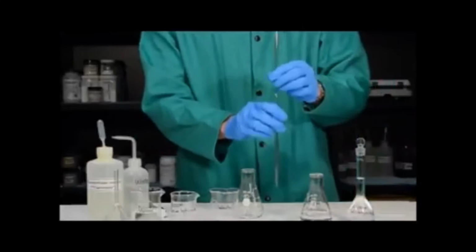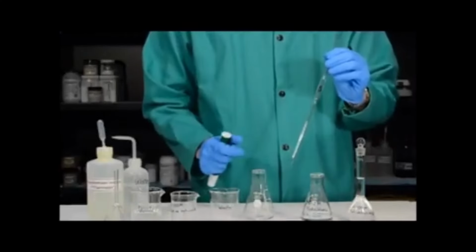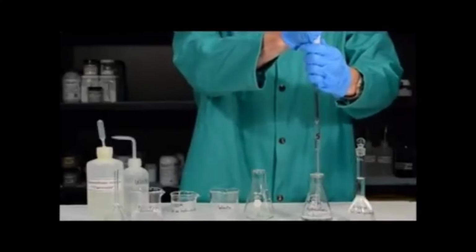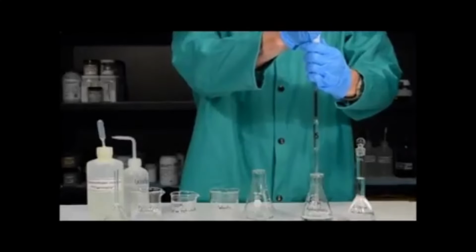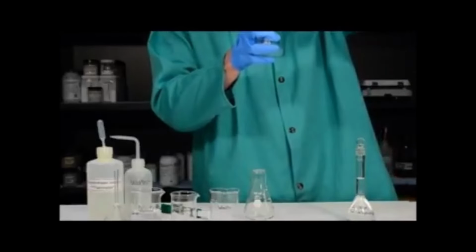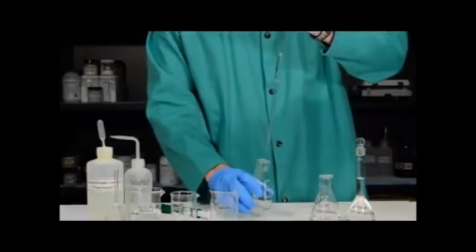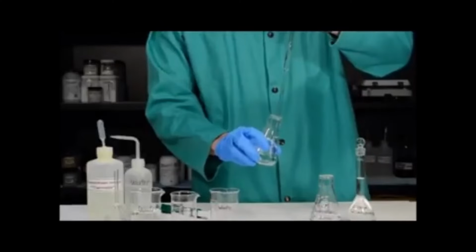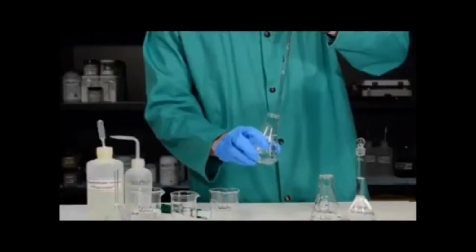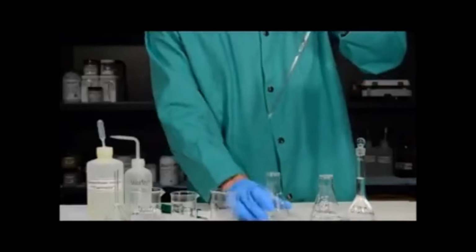We want to use a 5 milliliter volumetric pipette to transfer 5 milliliters of the hydrochloric acid solution into the Erlenmeyer flask. You've already used a transfer pipette previously, so we will do the same procedure now and draw the hydrochloric acid up above the calibration line, bring the solution to eye level, and stop at the calibration line. We then transfer the solution into the Erlenmeyer flask with which we're going to perform the titration. Notice that again, I'm allowing the solution to come out by gravity and I'm not blowing it out using the pipette pump.